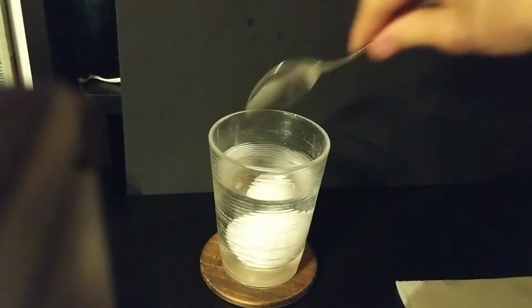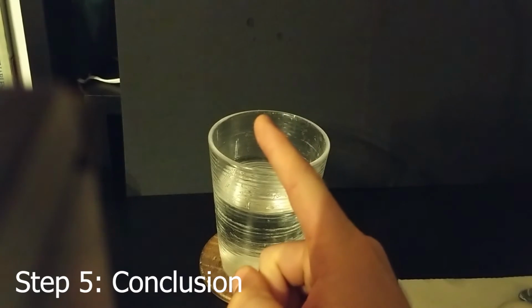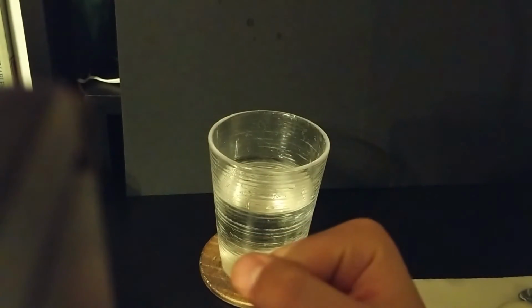Now I'm going to use the spoon to get this out of here. Alright, so what do we know from this? Well, step 4 is to observe what happened. It sunk to the bottom. It definitely did. So my conclusion is that my hypothesis was correct. The egg is going to sink to the bottom of the water.